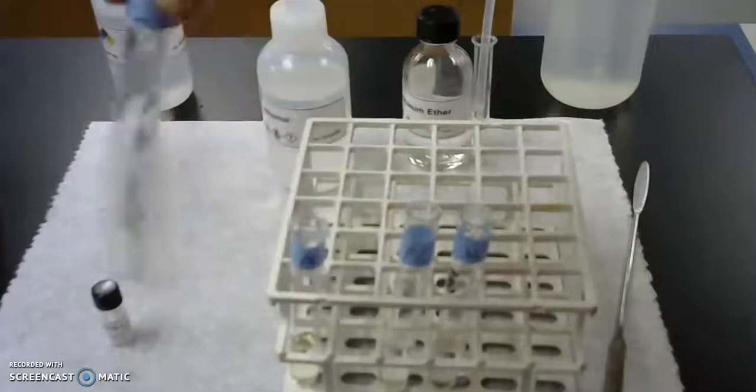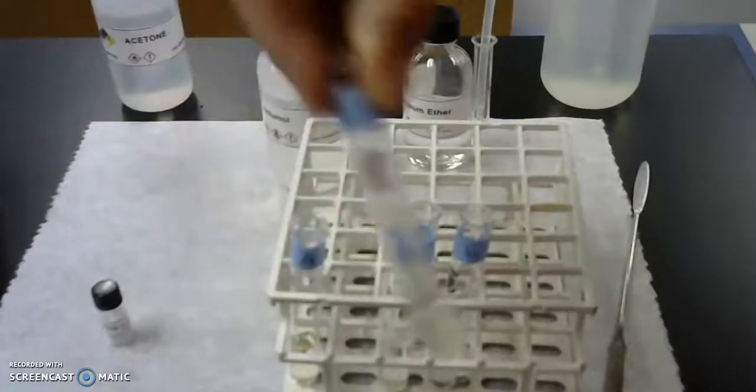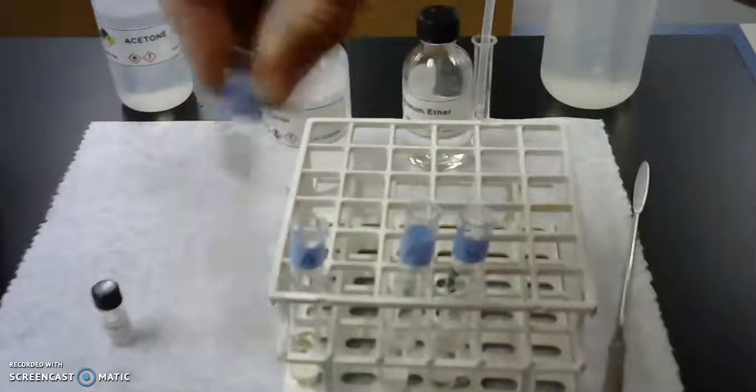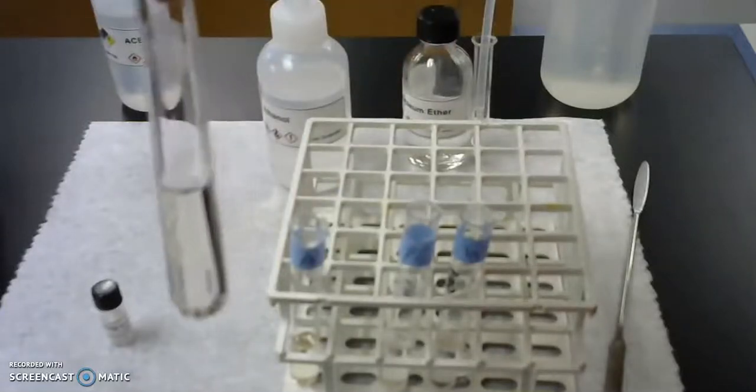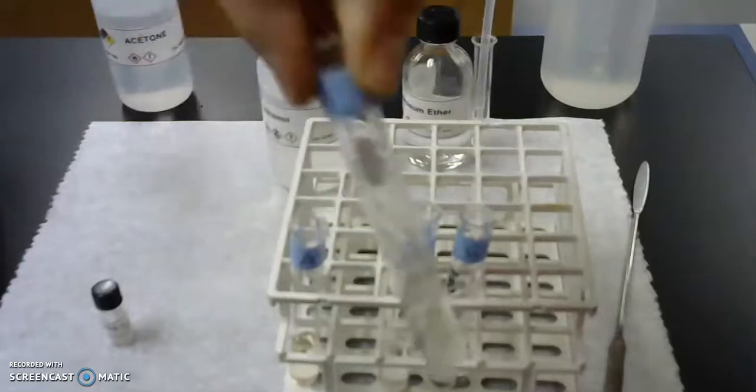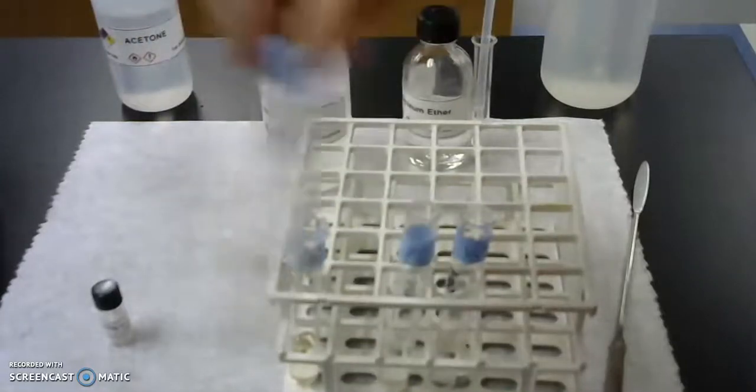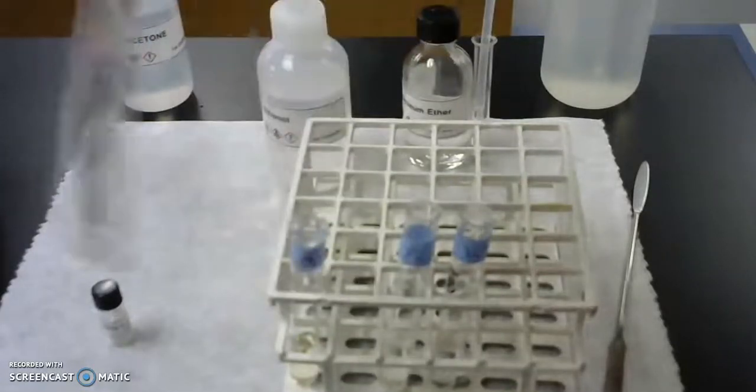And we'll mix it really, really thoroughly to make sure we've done all we can to dissolve it. So that's the ethanol. And again, record your results for the ethanol.